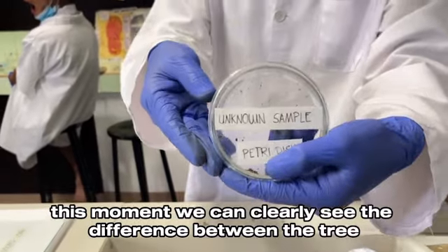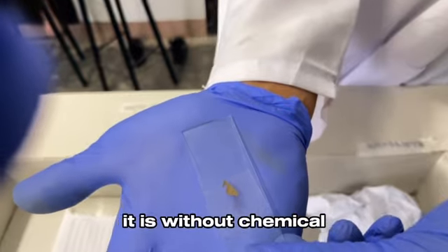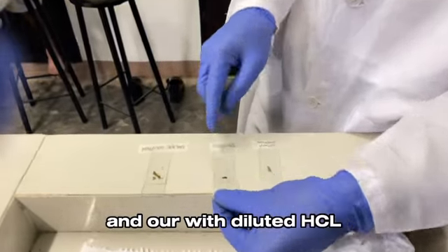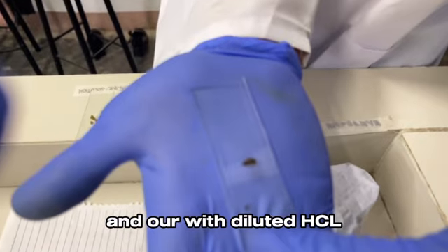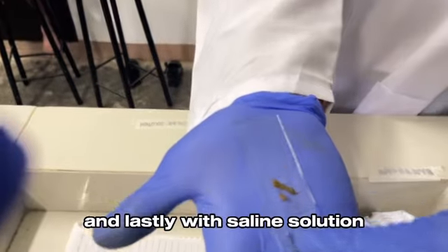At this moment, we can clearly see the difference between the three. This is without chemical, this is with diluted HCl, and lastly, with saline solution.